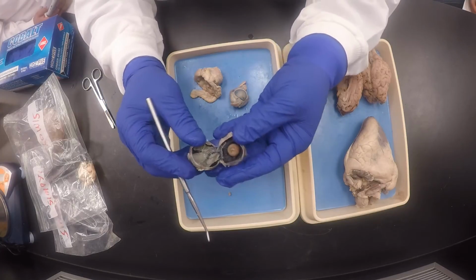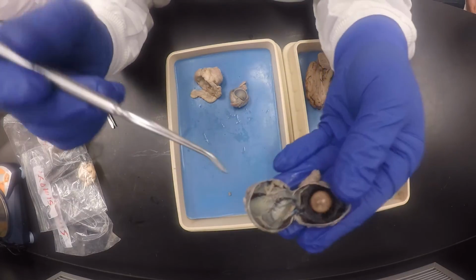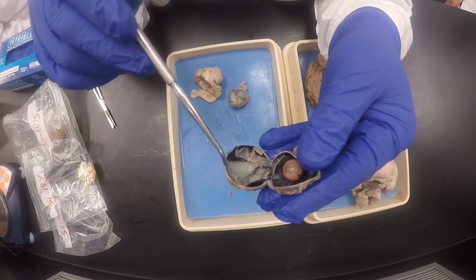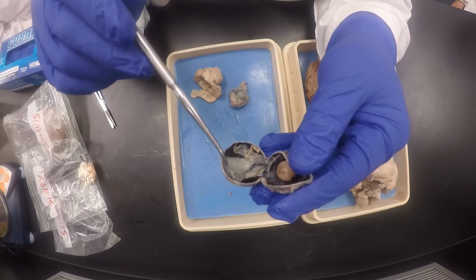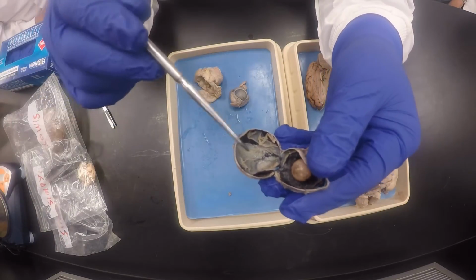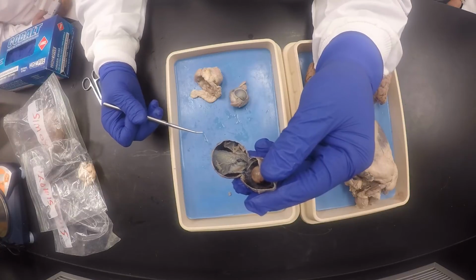Then you cut it and you open it like a page in a book, and then you see there's the lens, and this little part here is the optic disc or blind spot. You're going to call it optic disc, and this creamish, yellowish stuff that looks like cream cheese is the retina. And the black layer, usually in the exam I ask, what's that black layer over there? Even without looking at it, it is the choroid coat.